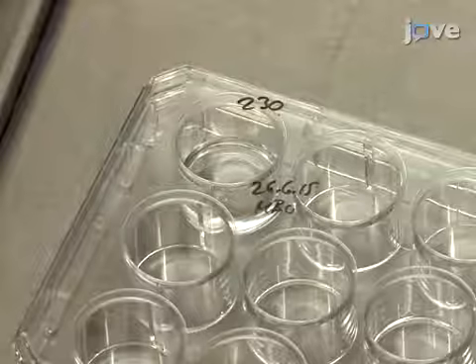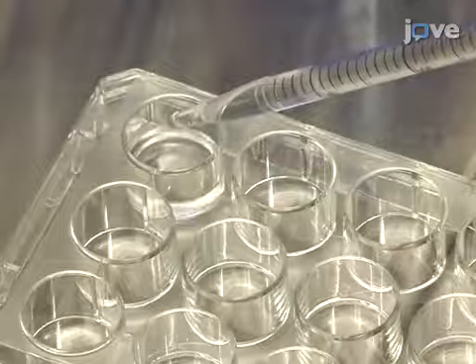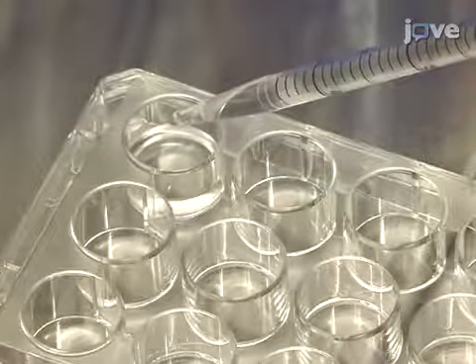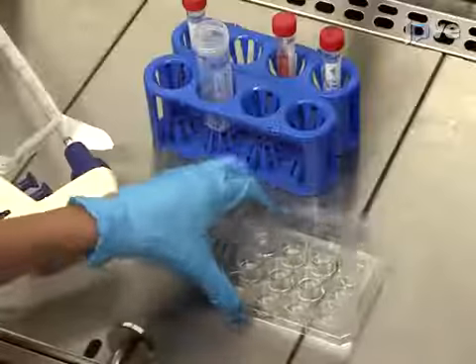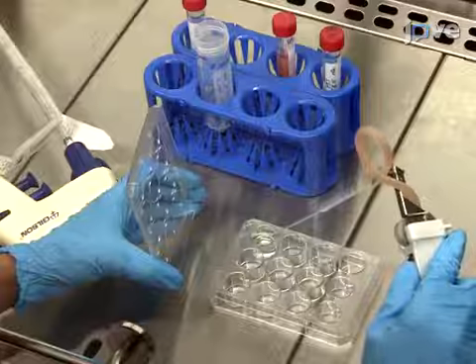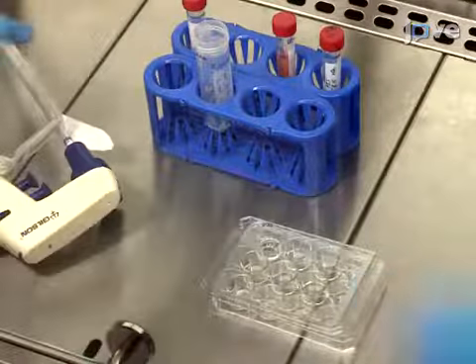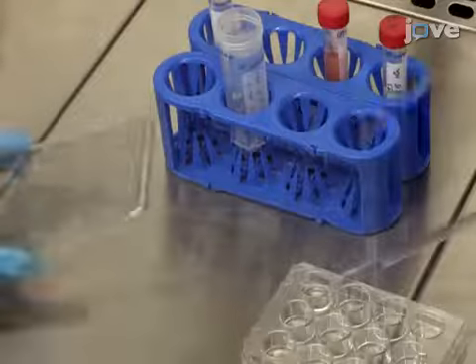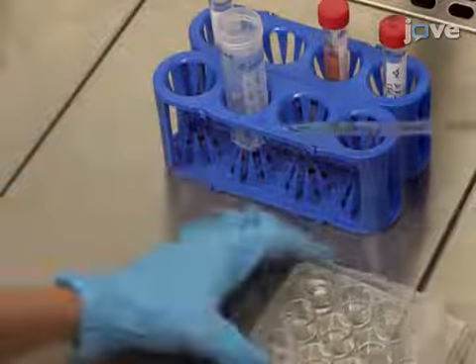Then, incubate the array at room temperature for 20-30 seconds before adding 1 milliliter of sterile deionized water on the side of the well. Once it mixes with the ethanol, aspirate approximately 1 milliliter of the ethanol solution from the well and add an additional 1 milliliter of deionized water. Repeat this process at least 3 times to wet the sample.